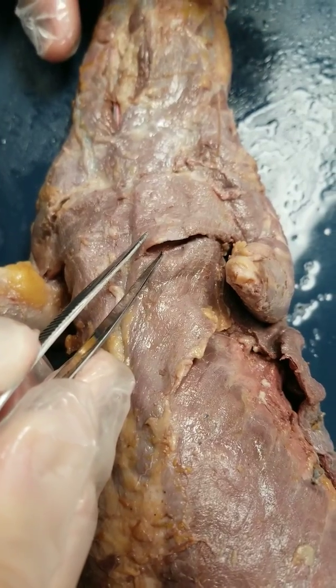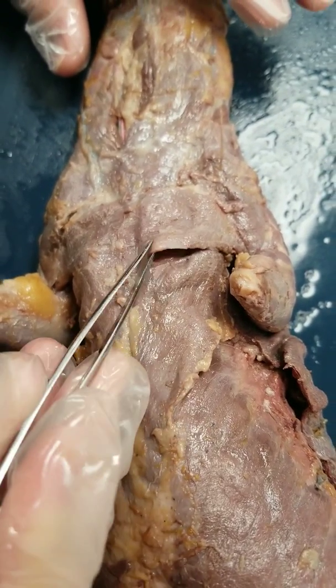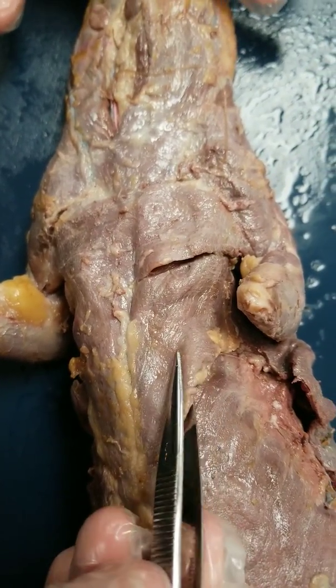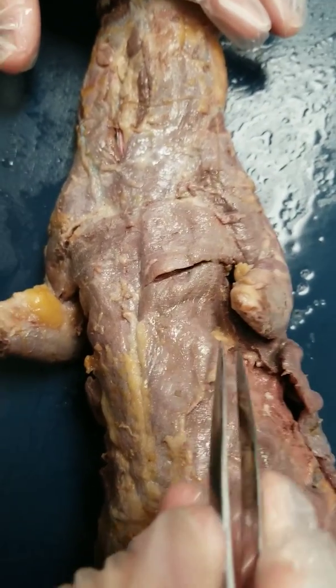The names in the human make a little bit more sense. The minor is larger than the major in the mink, and it has to do with how they walk. So this is the pectoralis minor, and you're just going to create a little band so you can lift it up.